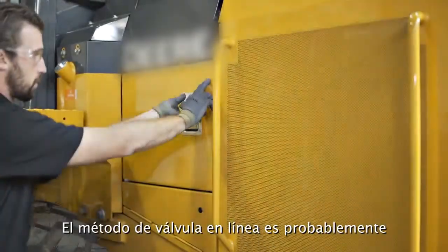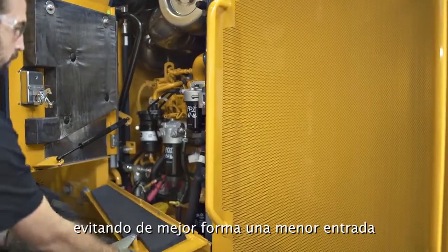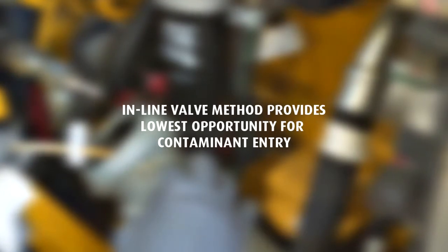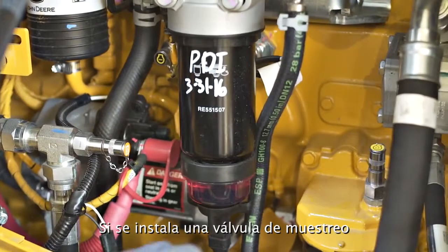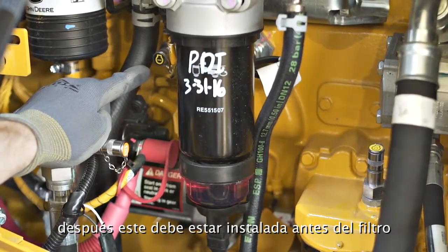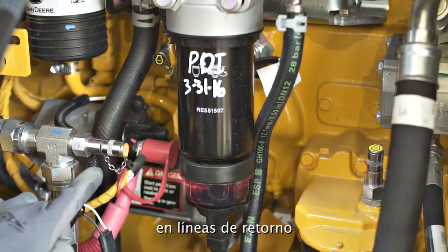The inline valve method is perhaps the most desirable method to obtain a sample. This method provides the lowest opportunity for contaminant entry due to sampling activity that would throw off your results. Equipment is commonly fitted with oil sampling valves from the factory. If installing an aftermarket inline sampling valve, they should be installed upstream of any filter in order to capture wear particles and preferably on return lines.